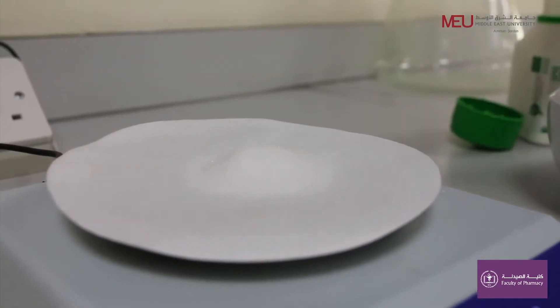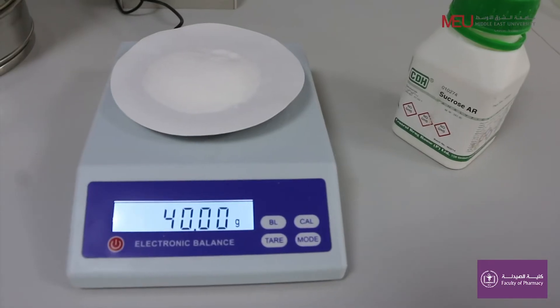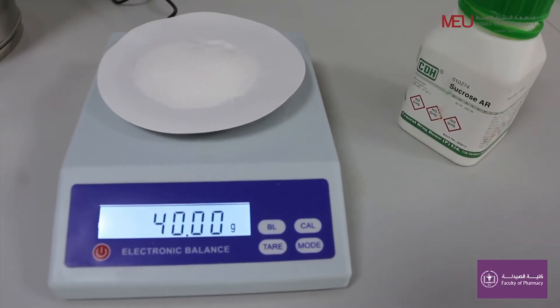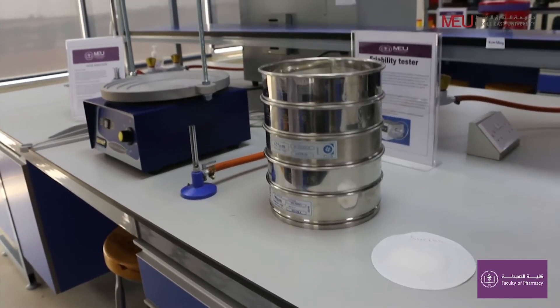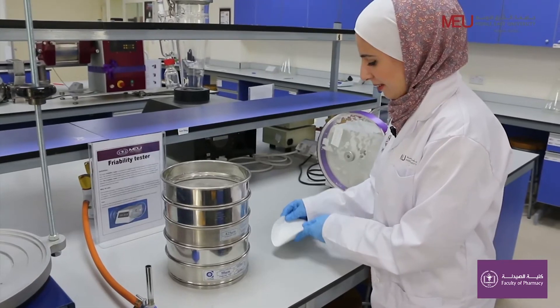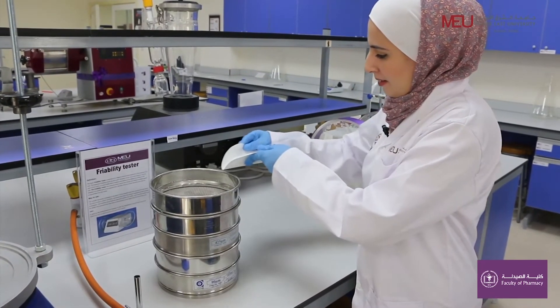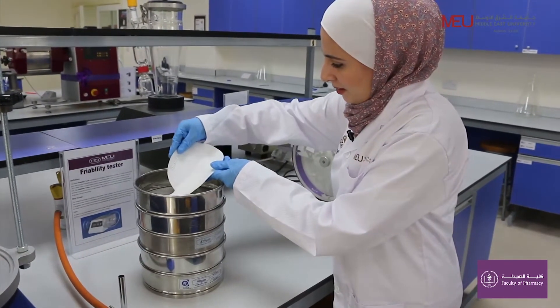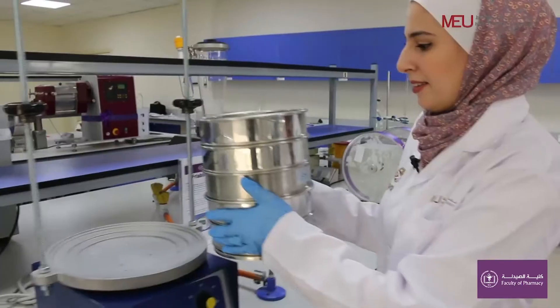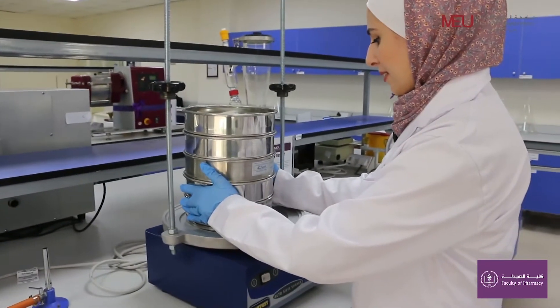Obtain your sample of approximately 40 grams. Put the sample on the top of the sieves, then place the sieves on the shaker.